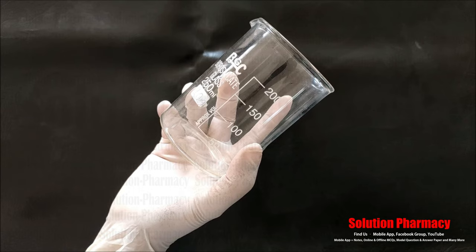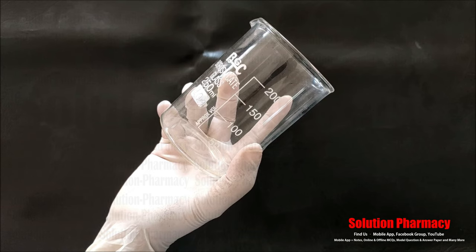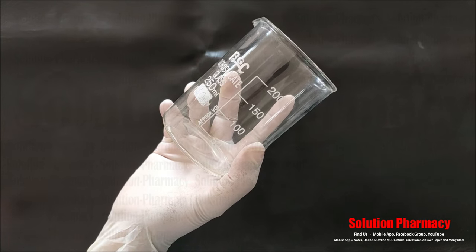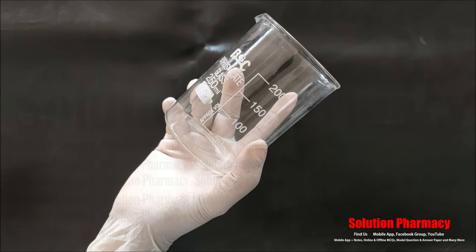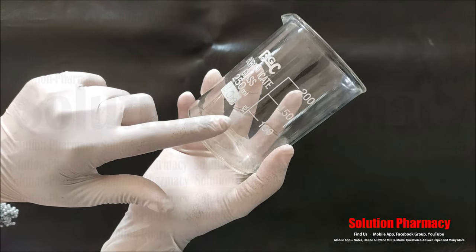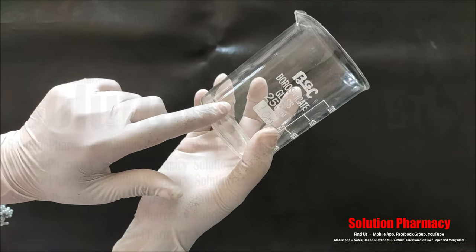Beakers are available in different sizes: 10 ml, 50, 100, 250, 500, and 1000 ml. You can see here this beaker is 250 ml. This beaker is graduated, so for volume measurement we can measure an approximate volume.